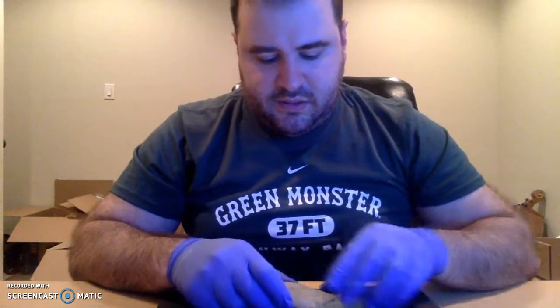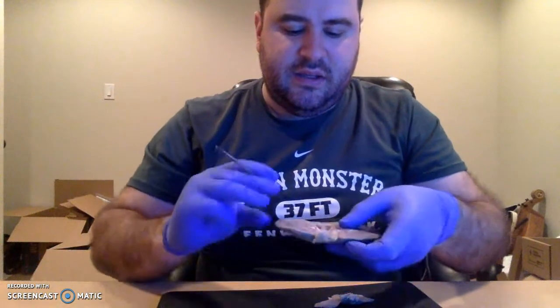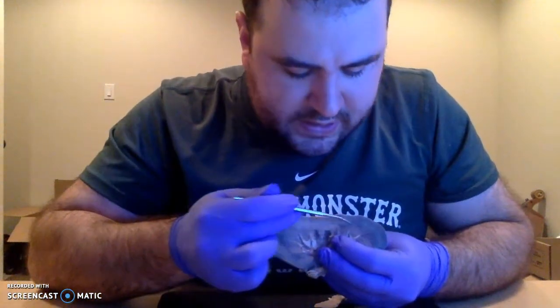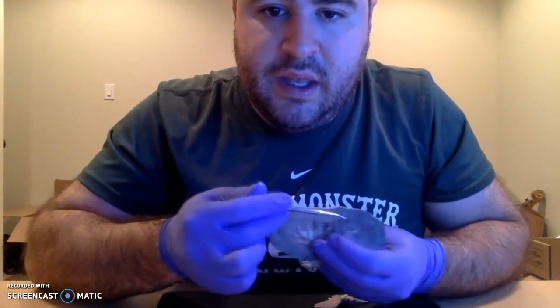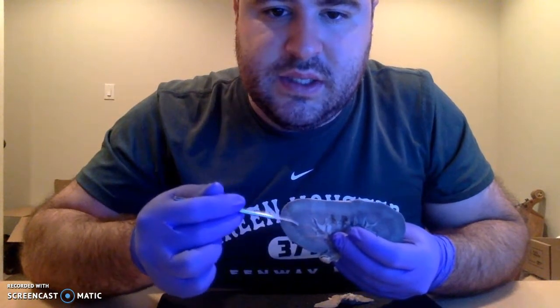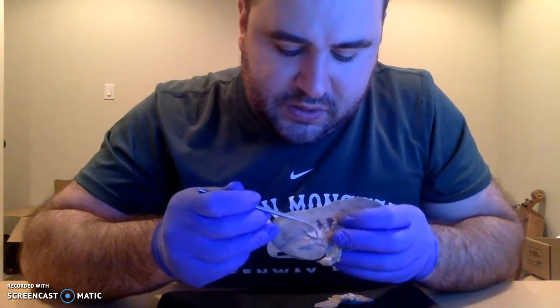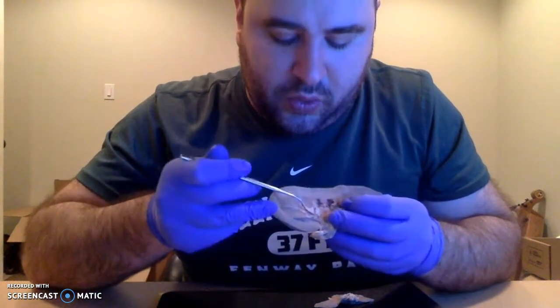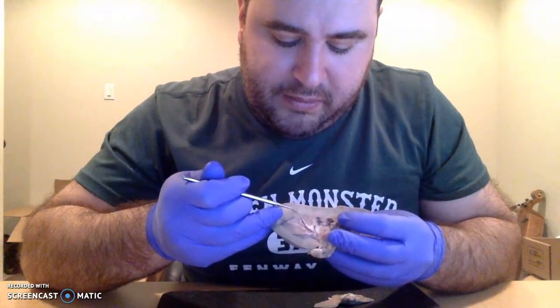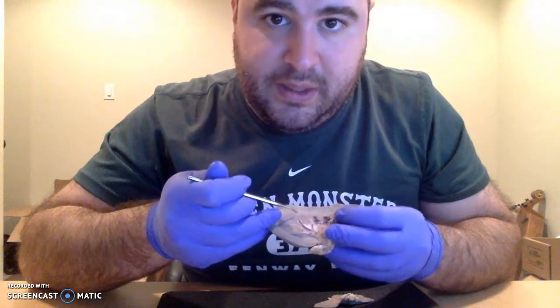All right, moving on to the internal anatomy. The kidney is divided into a renal cortex, right here. It's kind of parallel banded, and a medulla, which is deeper to it, right here. And in the medulla, we have these renal pyramids, which are these vaguely conical shaped things that kind of angle towards the hilum. And they are separated by renal columns, which are almost like projections between them from the cortex.